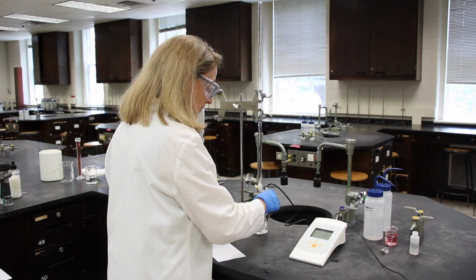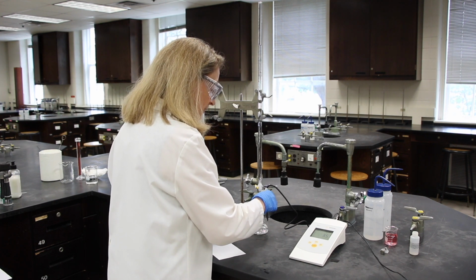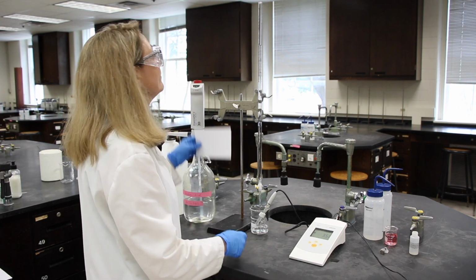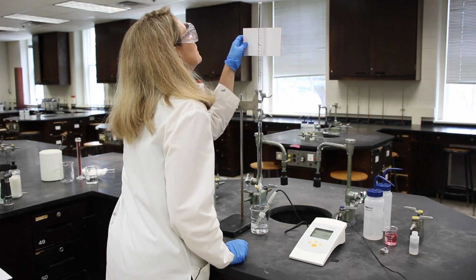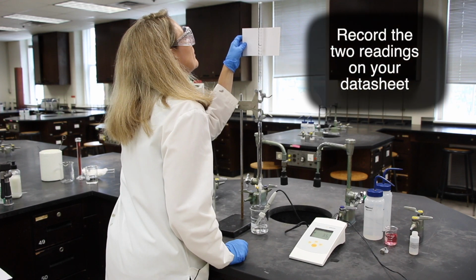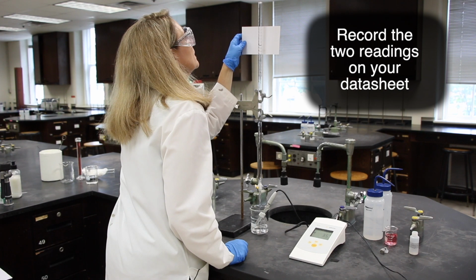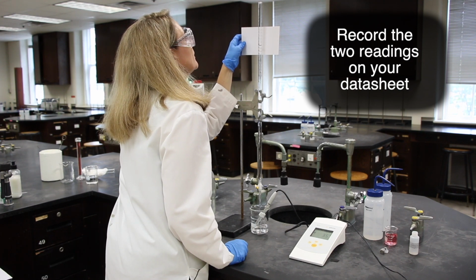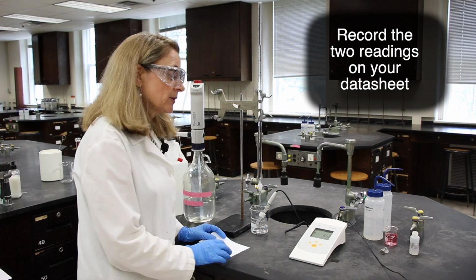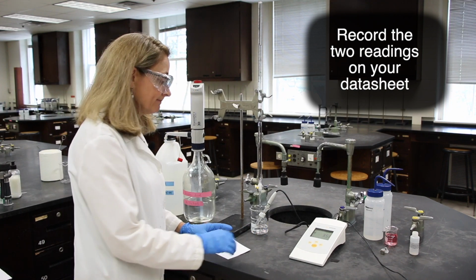And then I'll use my electrode as a stirring rod, and I'll read it. At 10.35 milliliters, and my pH is 3.58.